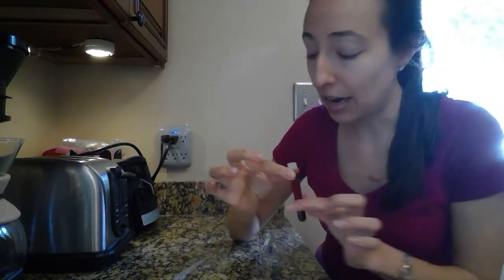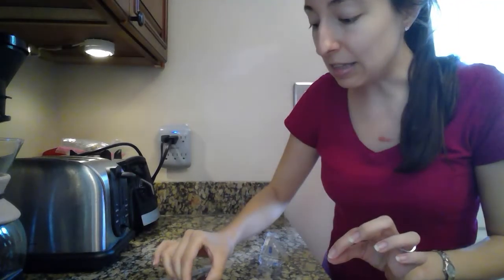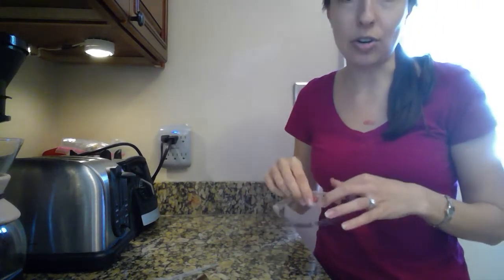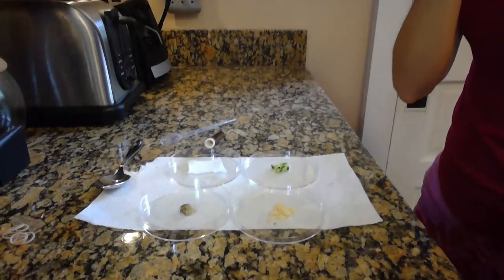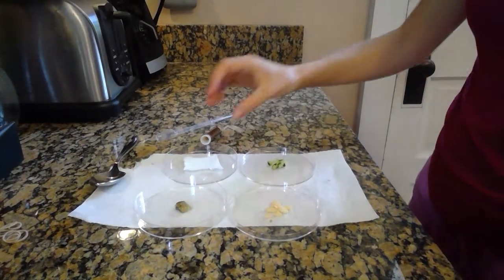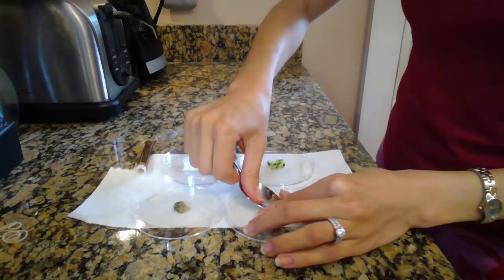And again, you want your iodine and a little pipette dropper. Now again, be careful not to let this stain. Maybe you wear an old t-shirt or an apron. And make sure to put on your safety goggles and tie your hair back, take off any long earrings or anything. Now you really just need 1 drop of iodine on each. You could do 2 drops, but I wouldn't do much more than that.